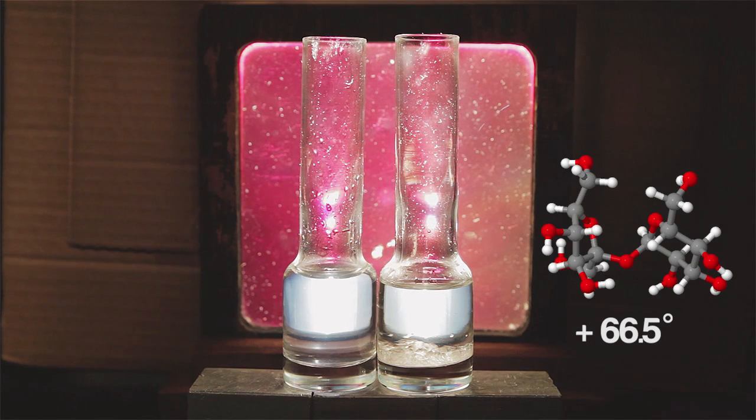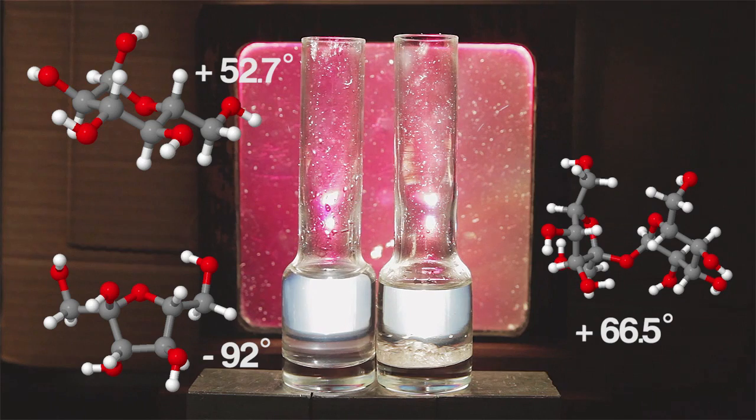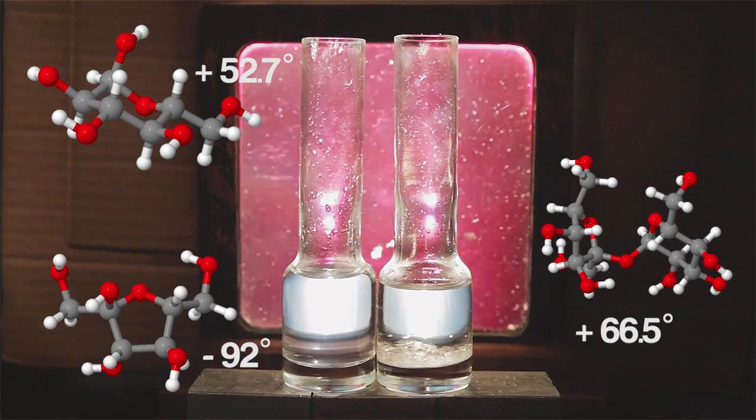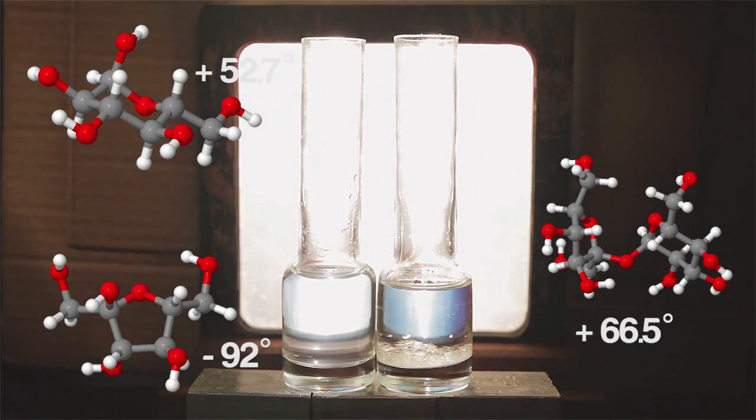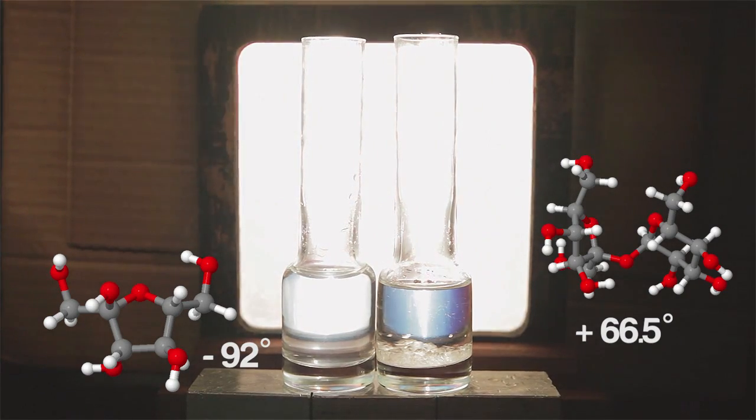But have I just added a glucose solution or a fructose solution? Both look the same. However, if you turn one of the filters back and forth, you can see our solutions are rotating in opposite directions. The one on your left is fructose.